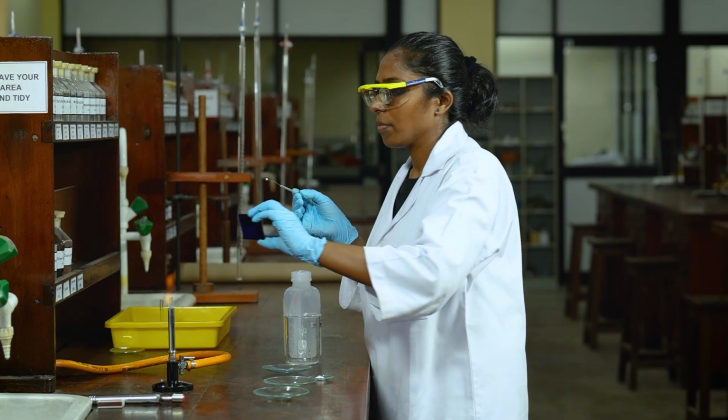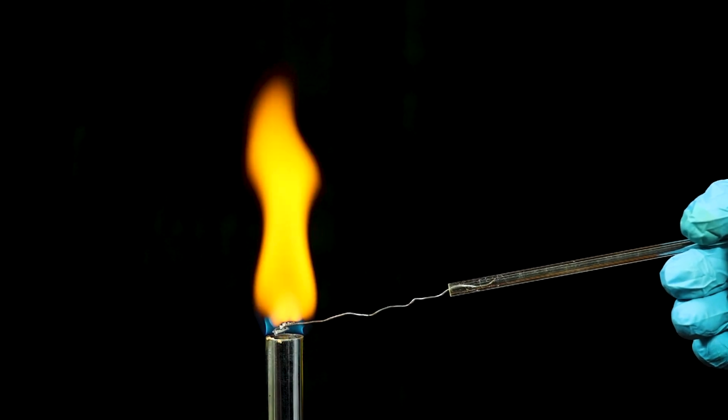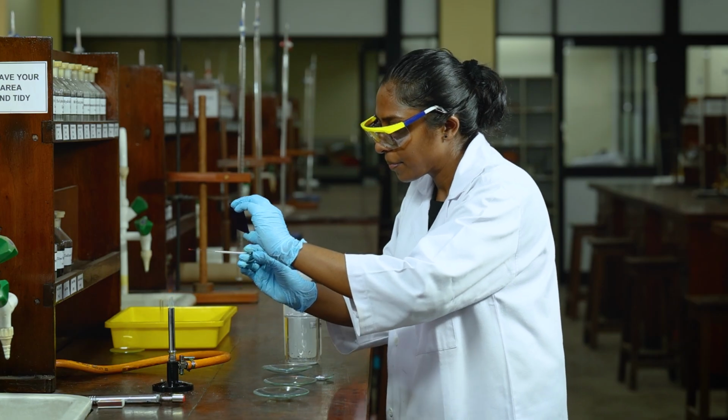If you observe a yellow color with your test sample, you also need to observe the color with a cobalt glass. A cobalt glass is used to observe the color of cations such as sodium and potassium ions, as it absorbs the yellow color of the sodium and the lilac color of the potassium will be visible. The reason is that most sodium salts are contaminated with potassium, or vice versa. So, sodium can interfere with the determination of the color of potassium. You have now completed testing the samples.